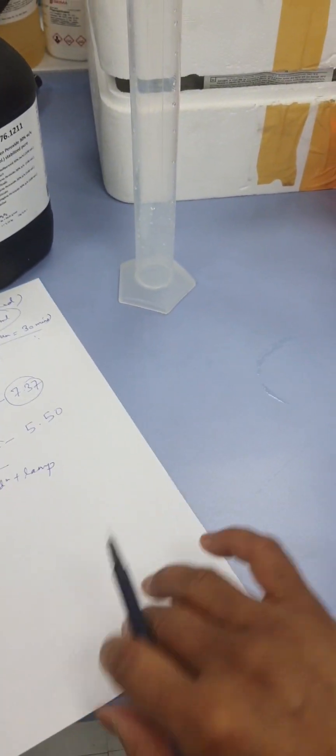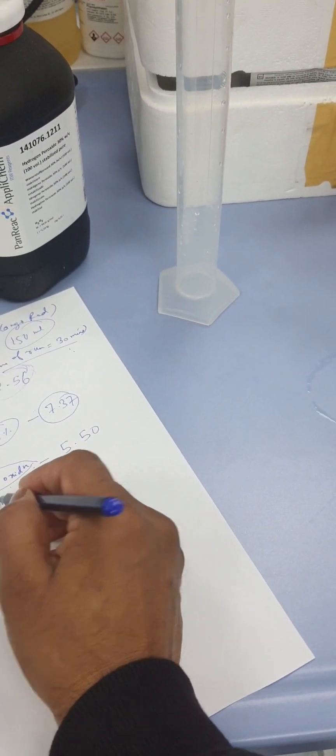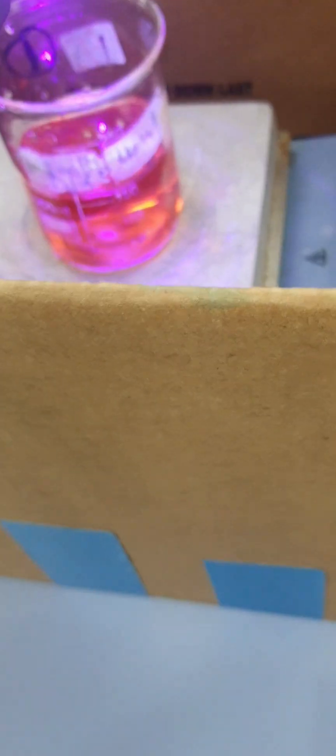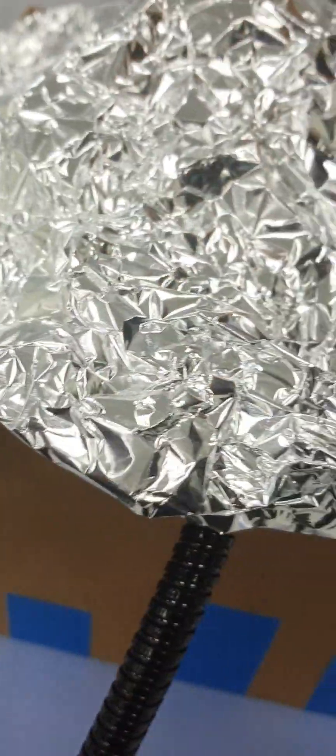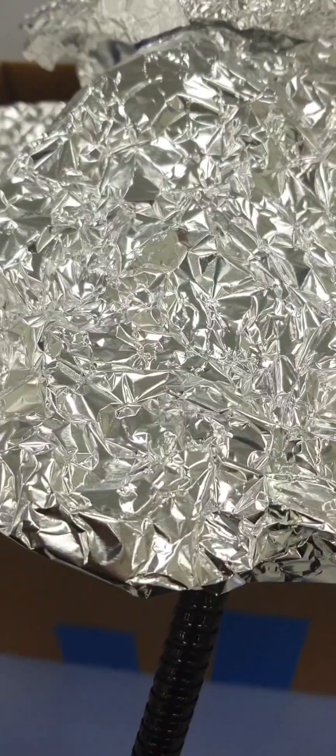Now we will just use the light and check the concentration. I will switch on my light. You can see the light is switched on now. Then we will cover this and run this for around half an hour and see whether there is any degradation or removal by means of light or not.